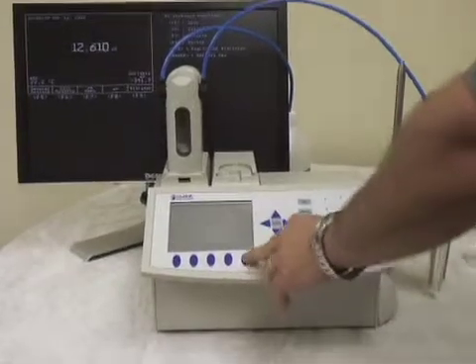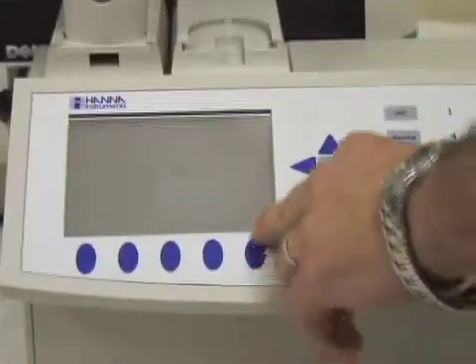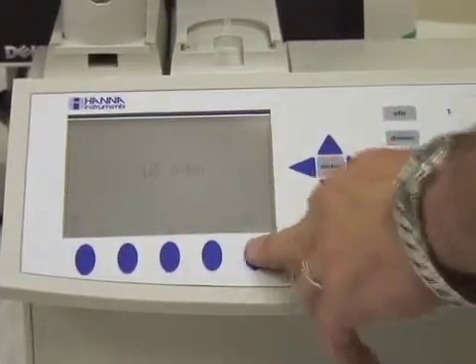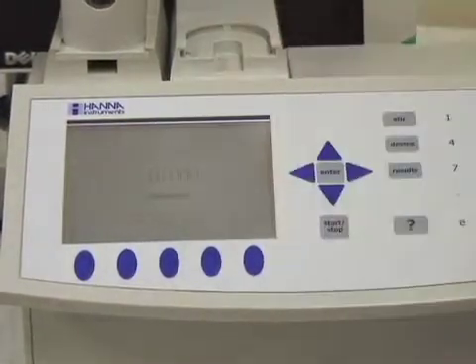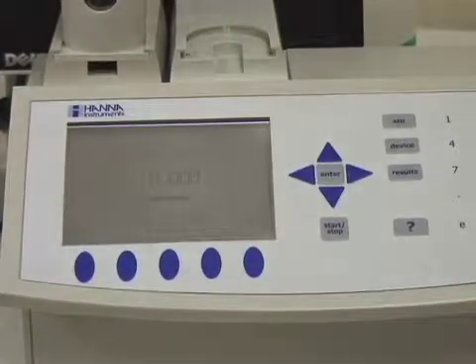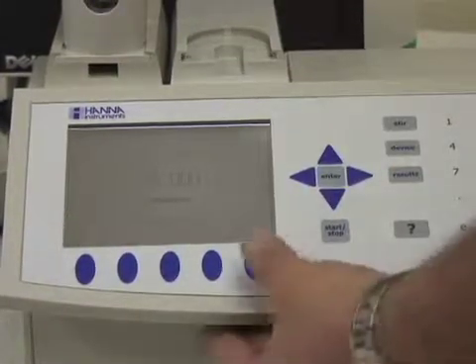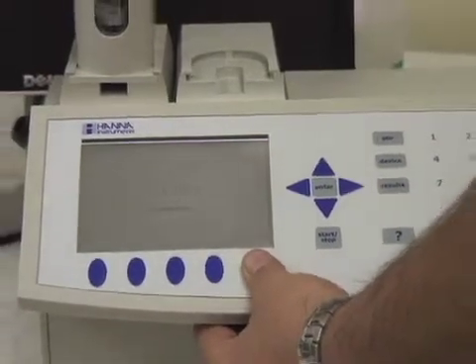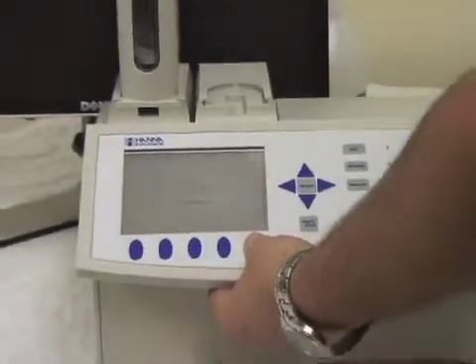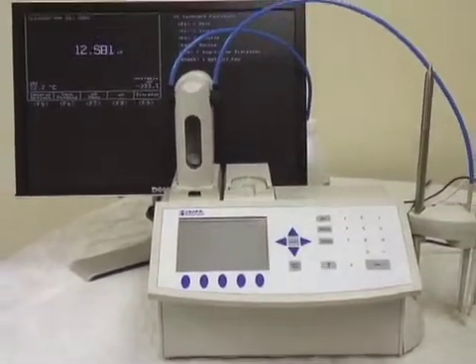Your right-most button will always be your titrator or pH mode. When it's in titration mode — we're in TA right now — this button will say pH. So we're clicking what will be the F9 button, going into the pH mode.